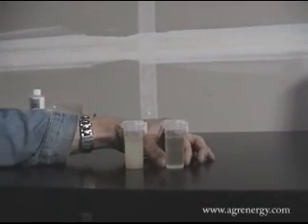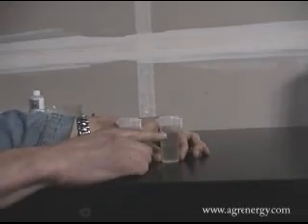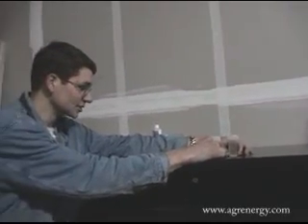So now we return to these samples about 5 minutes later, and we observe what's happened. This sample, the fuel that's likely to pass ASTM, has stayed clear. Once again, because the biodiesel dissolved into the methanol, it can't settle. It's molecularly suspended in the solution.